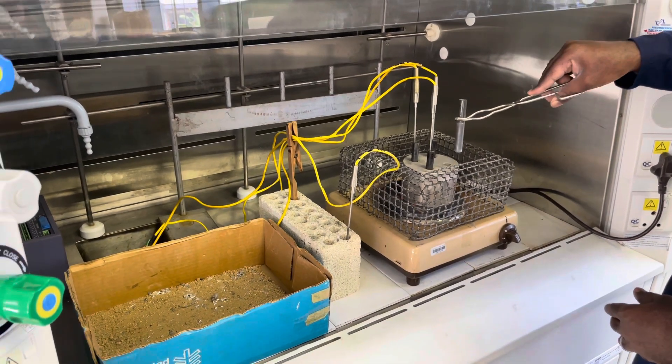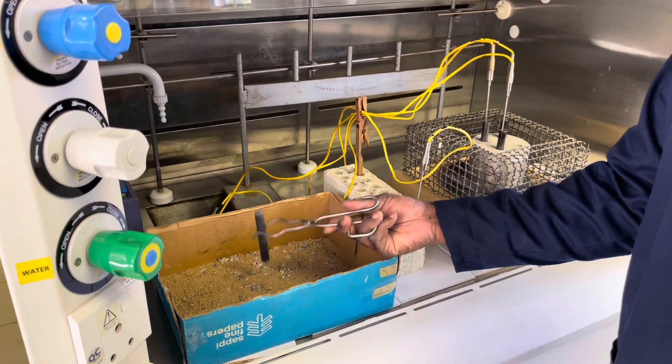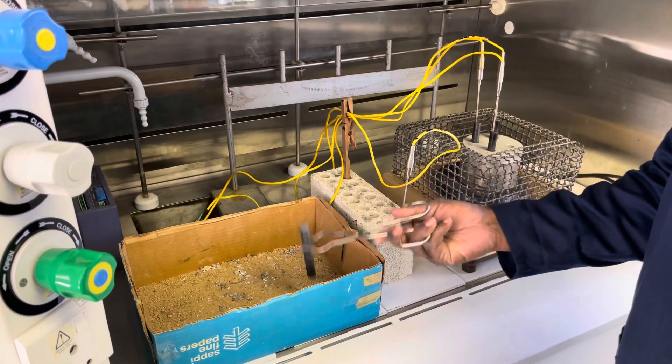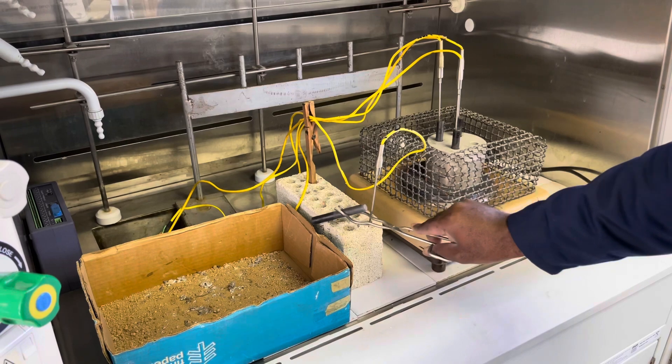This will not be easy — you will struggle quite a bit — but just work slowly and safely, and ensure that you discard all the metal before placing the steel test tube back in the cooling rack.